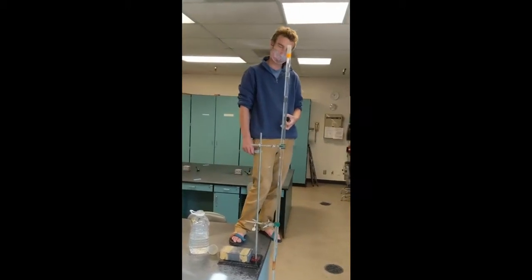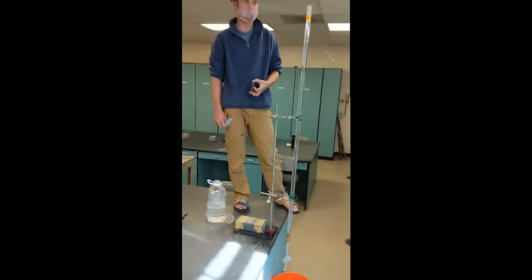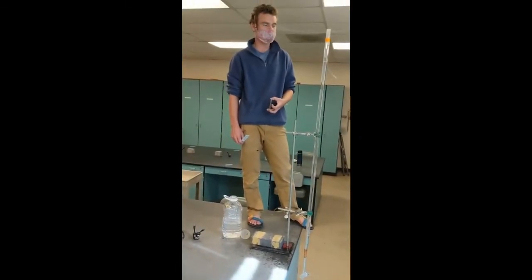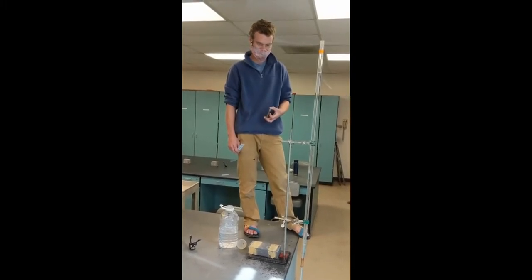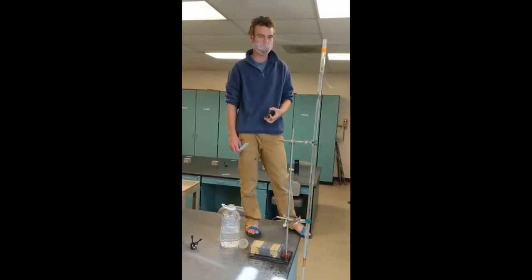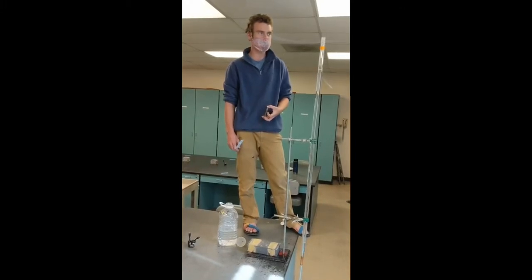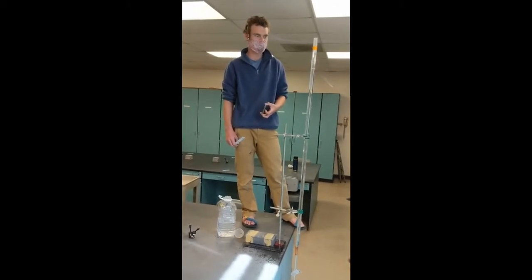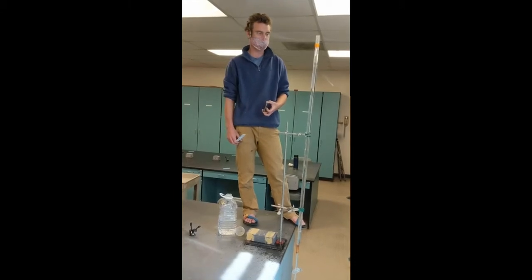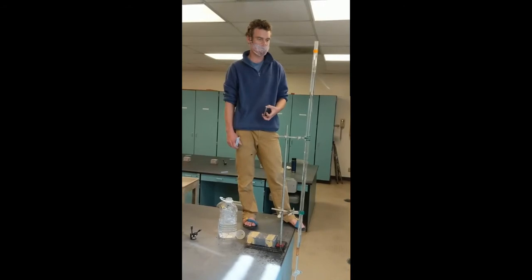All right, Carl and I are here to talk about how we process sediment samples. The goal of this lab and this procedure is to figure out the proportions of different grain sizes in a sediment sample. We talked in class about the importance of grain size and figuring out what types of sediments are in the benthos in different places in the ocean, and how that's related to the abundance and diversity of organisms that we find. Today's procedure is to try to figure out exactly what those proportions are.